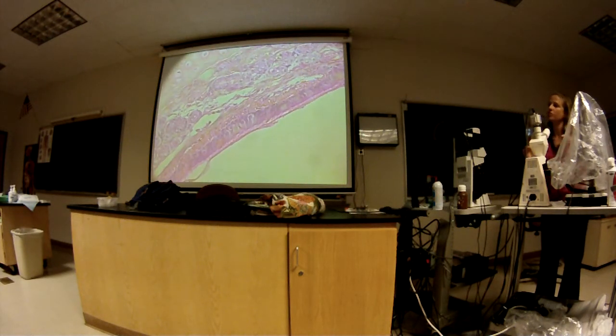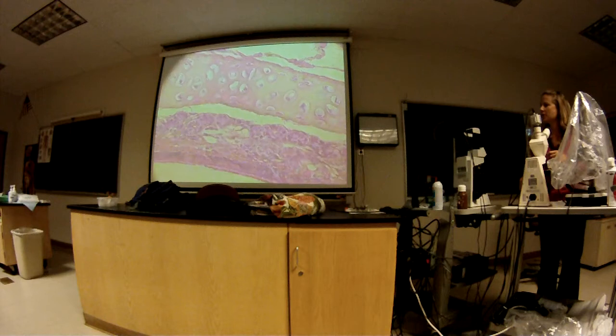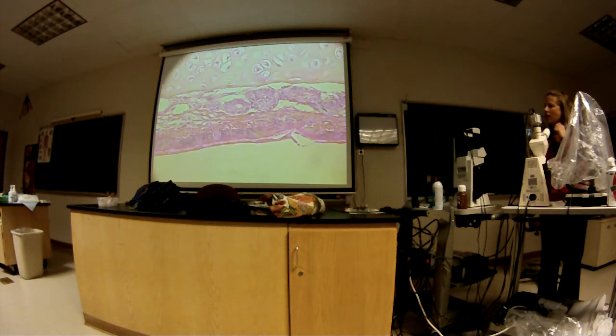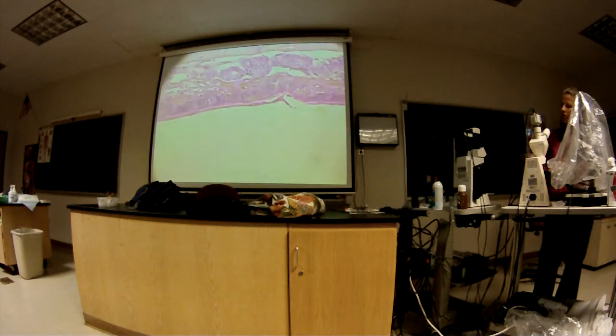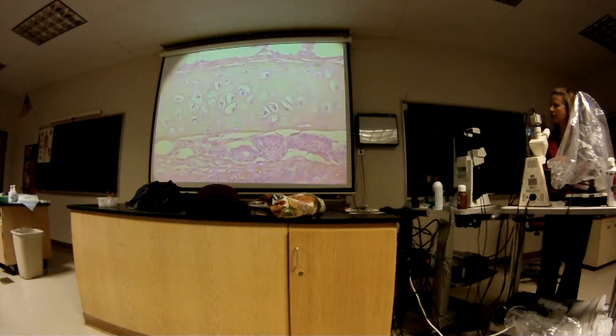Don't mix up the two, bronchiole and bronchus. They sound very similar. They're spelled very closely. Easy to mix up. Can you find a lymph nodule on that? It's not on this slide. I was just looking for it on that last slide, but I'm not as good with this scope, and it takes me longer to do things. I haven't seen it on video. We'll go back if we get all the way through, and I'll look for it again. I don't want to waste your time.